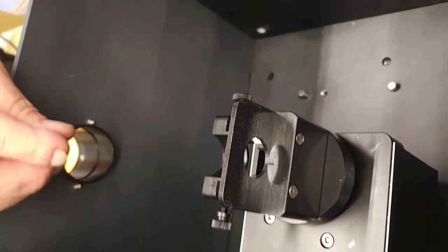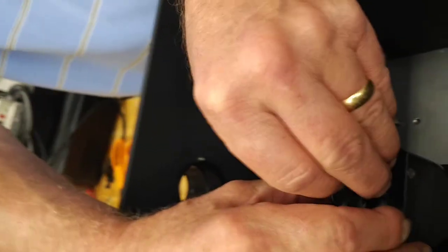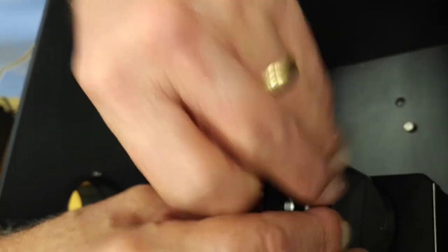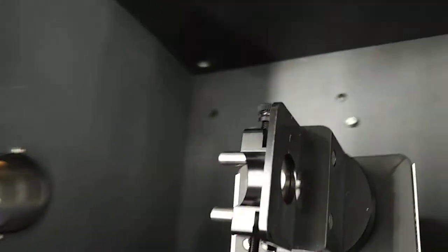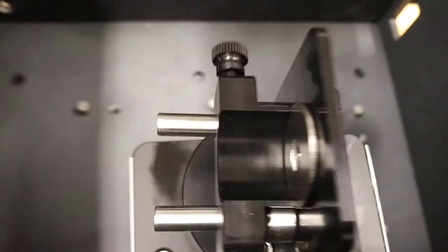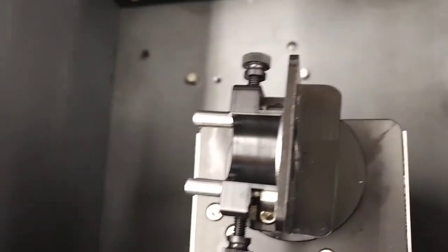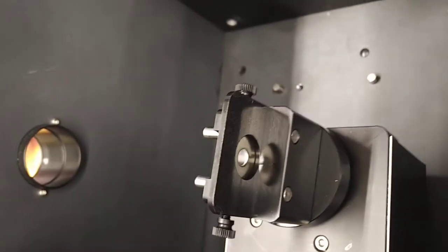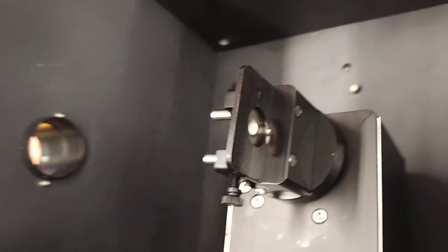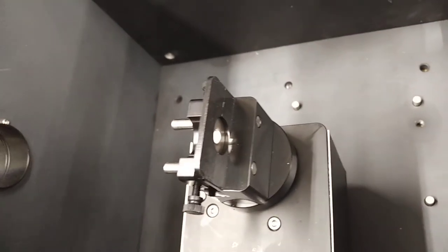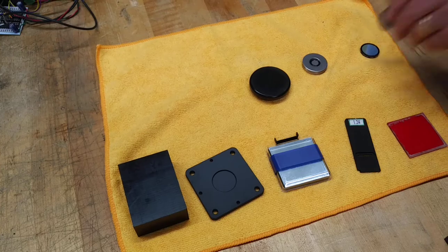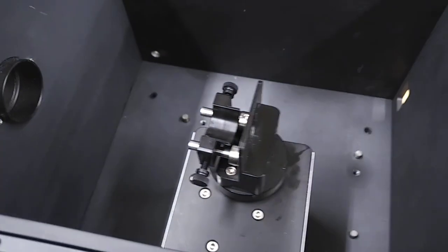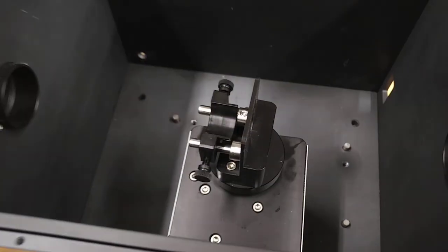Okay, that's our last one. And then we have a very thin round one. So clearly the instrument is capable of holding a variety of sample types, diameters, dimensions, and sizes with ease.